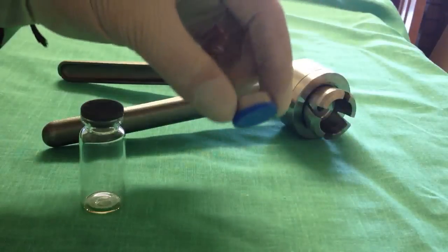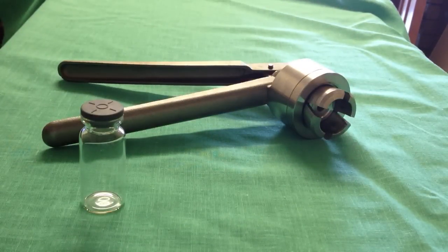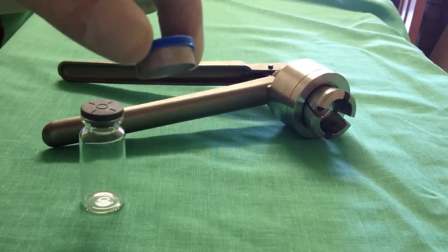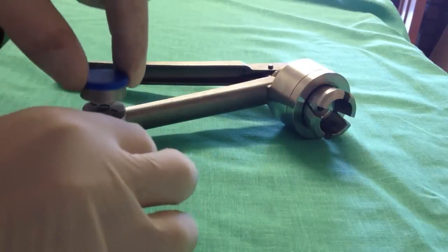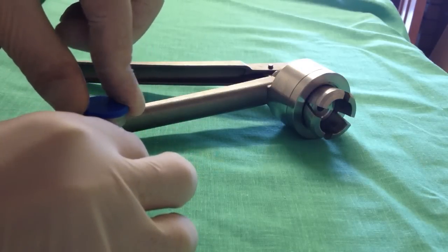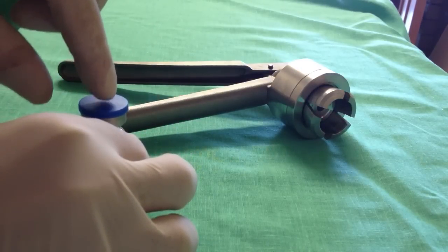Now, most importantly, get the actual cap and try not to bend any of the edges and just slowly put it over until everything is level.